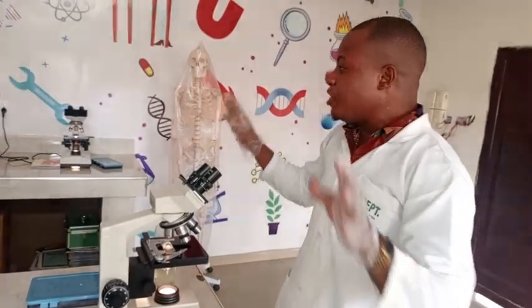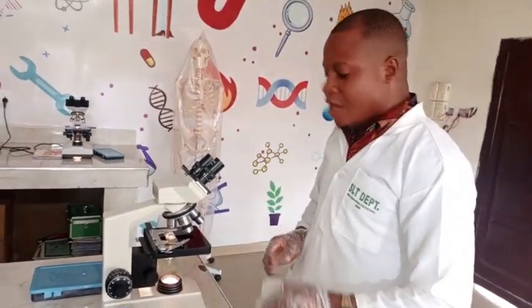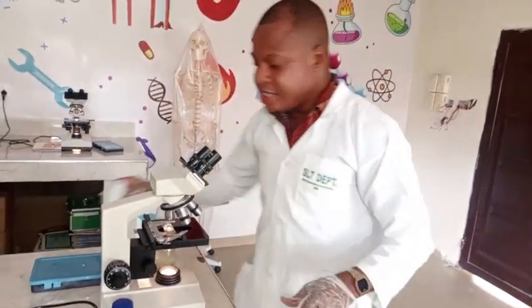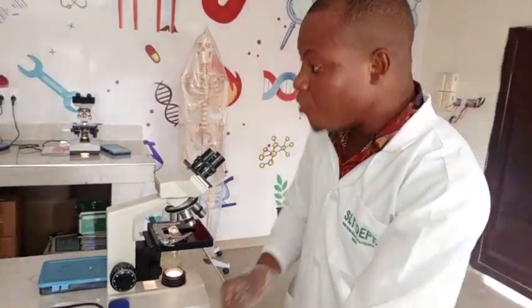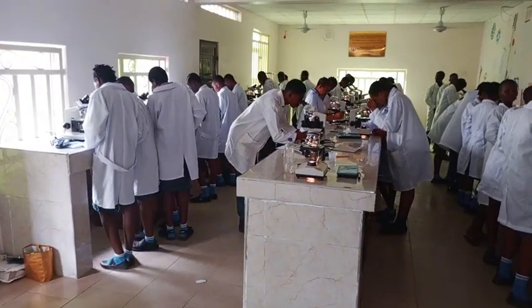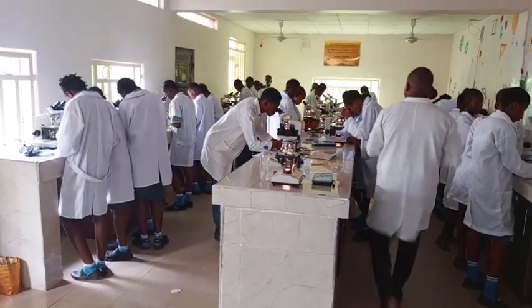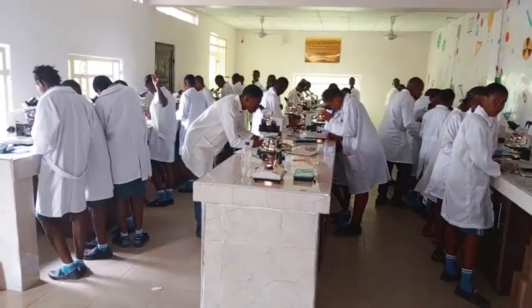So you're going to turn on your own light source now and carry out the same procedure, and I'm coming to inspect each and every one of you. So these are the materials. You can come to pick them. If you have planted your own, don't step on it. Let me continue.